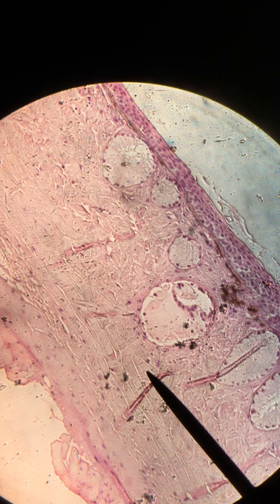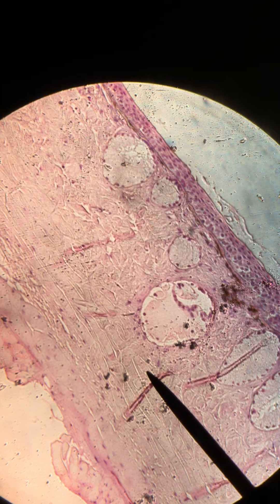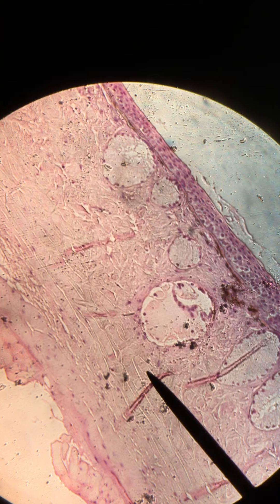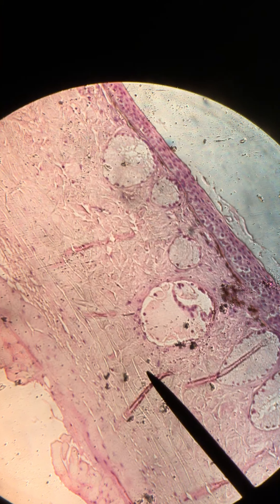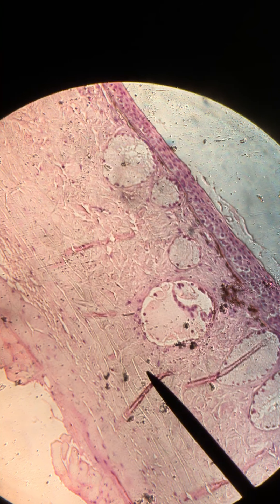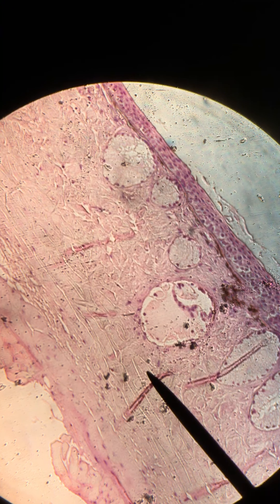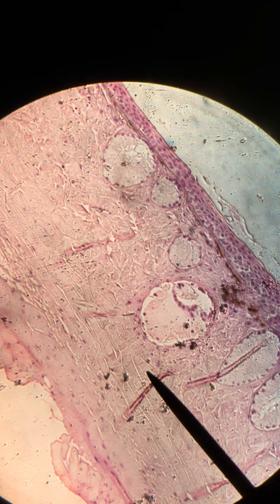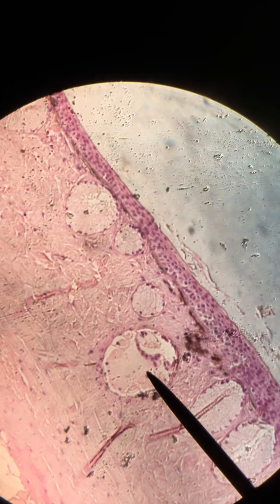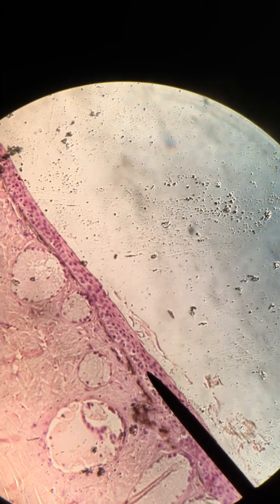Hi, GenBio. This is slide number two, the skin slide, and there's a lot of different things we can see in this slide. Right now we are at a hundred times magnification, and I'll just point out that you can see some epithelial cells here.